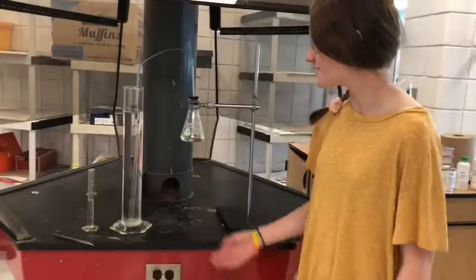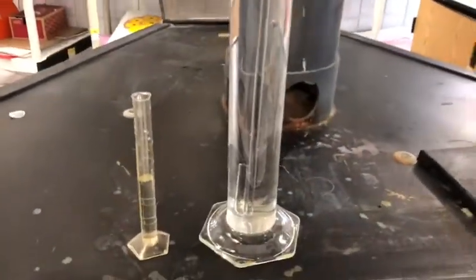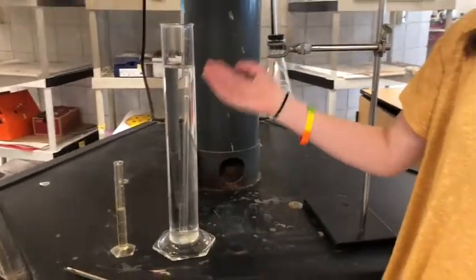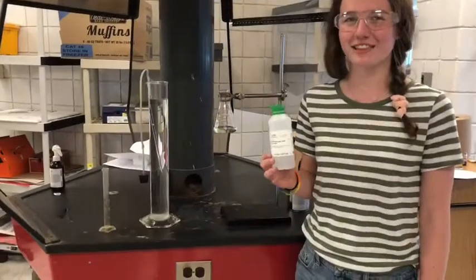We will add 15 milliliters of hydrochloric acid into the bleach solution. Then we will quickly cap it with the rubber stopper, and then we will swirl it until bubbles form here, and then we will add our calcium carbide, and the reaction will start. Measure out 15 milliliters of the hydrochloric acid solution.